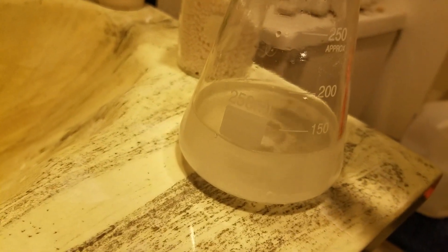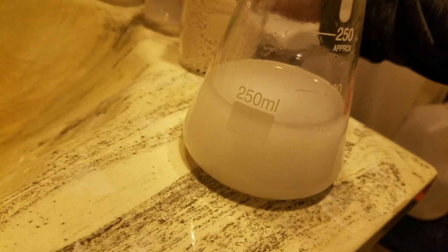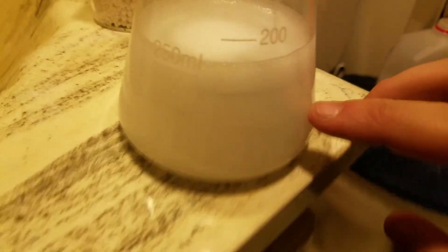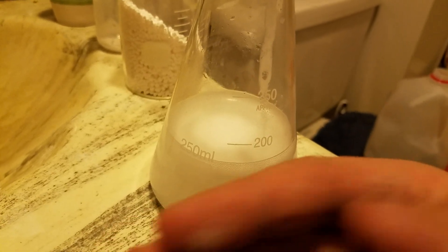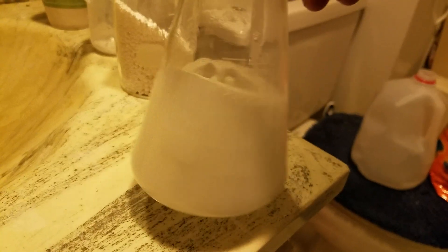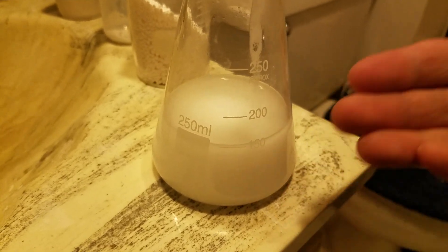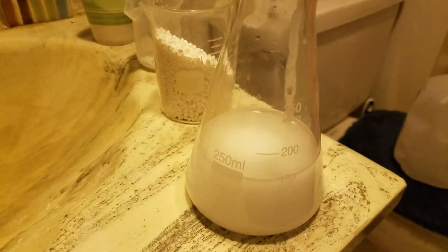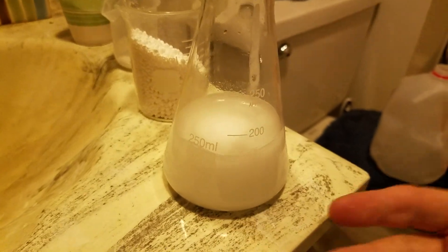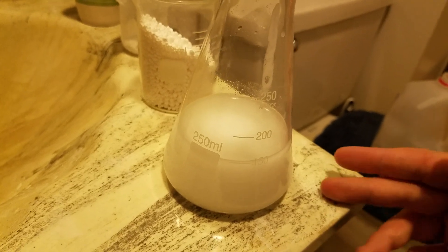Let's just add one to the other. Oh, there it goes. Calcium chloride is reacting with the sodium bicarbonate, reducing everything down into salt and essentially powdered limestone. Now this is just a quick demonstration video. Ideally, you would make equal volumes of saturated solutions of each — saturated baking soda and saturated calcium chloride. I was racking my brain about this for weeks until it finally dawned on me while I was walking past the front door and saw the 50-pound bucket we had bought for our driveway, because we're in Pennsylvania and we are buried.